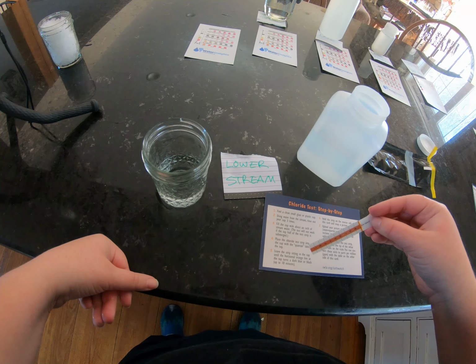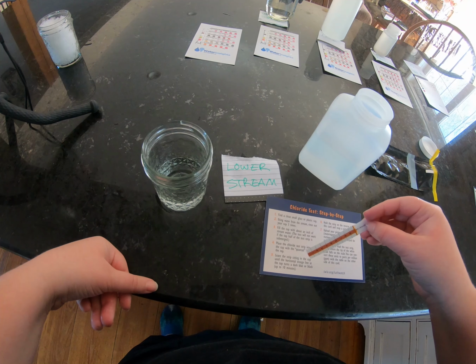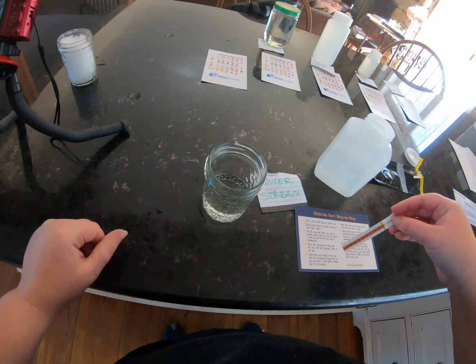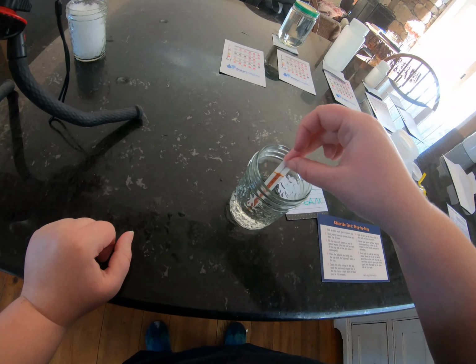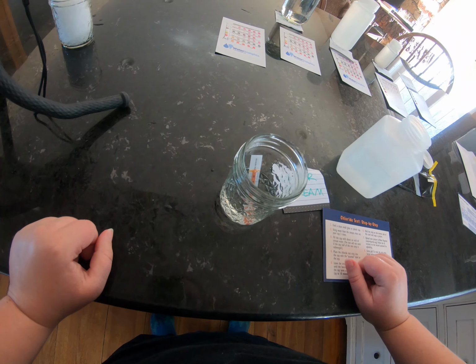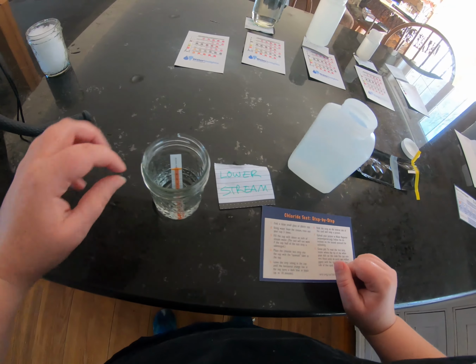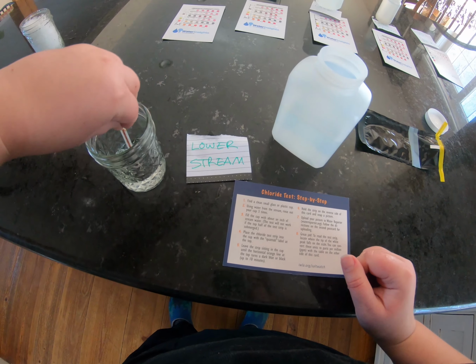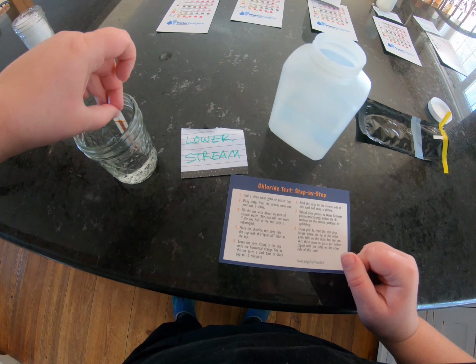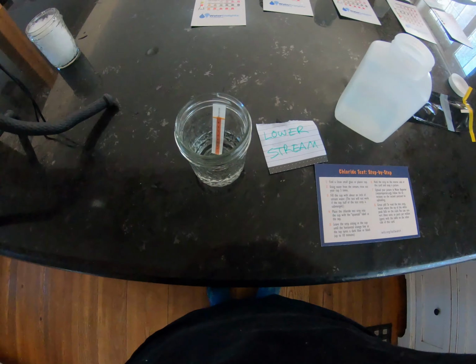I ran an additional test on two of my testing sites using water testing strips from Winter Salt Watch, a program trying to track road salt pollution, which can damage roads and cars, be toxic to aquatic life, and when polluting groundwater, can cause health problems such as increased hypertension. I tested the lower Suckerbrook sample, so the one closest to the lake, and I also tested that catch basin where I saw salt nearby.